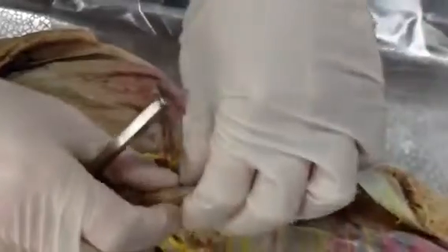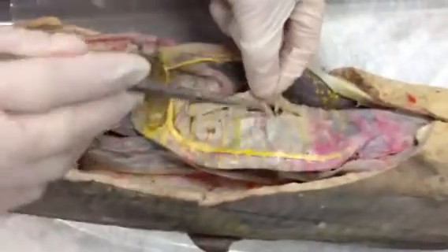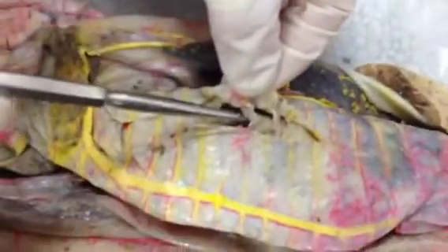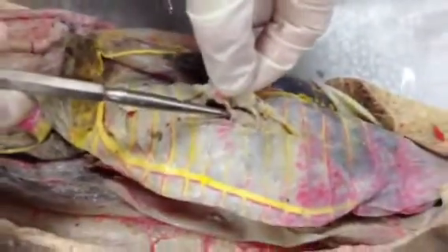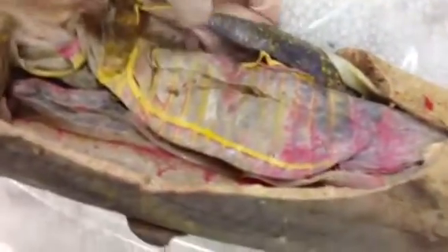At the end of the stomach you have the pylorus — this region here — and it has a sphincter in it that prevents backflow. The valvular intestine, or spiral intestine, is here and it has the spiral valve in it.